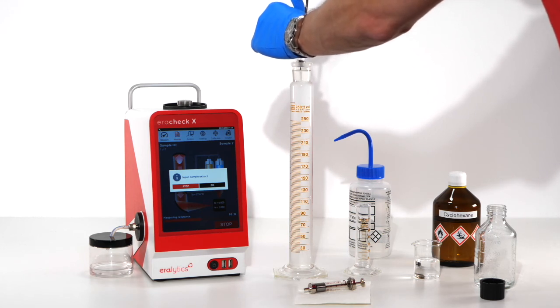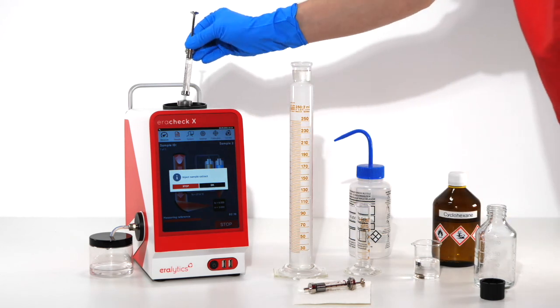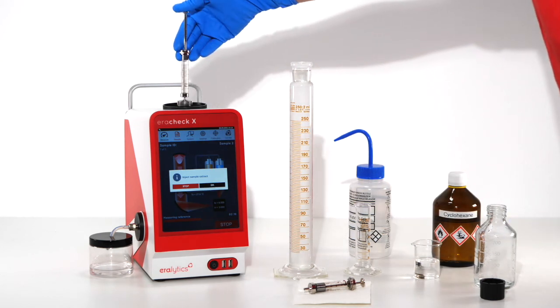Then attach the syringe to the inlet assembly on the top of the analyzer. Slowly inject the sample and press OK on the screen.